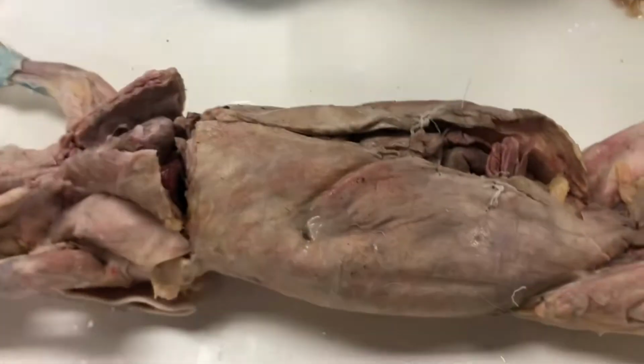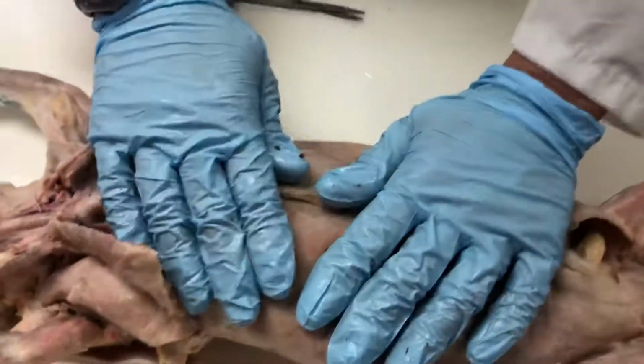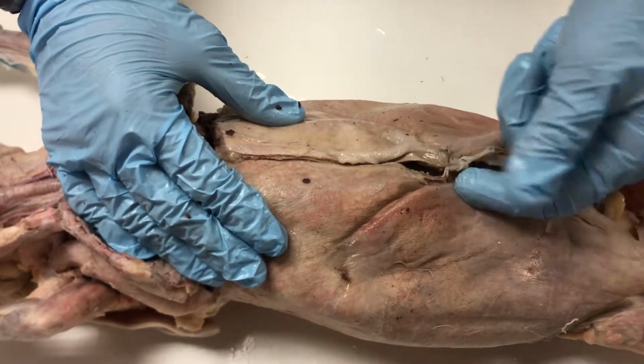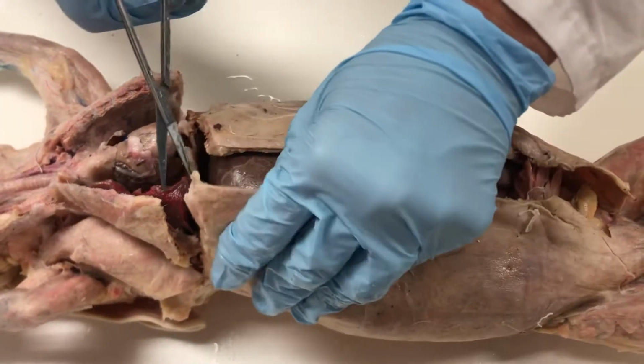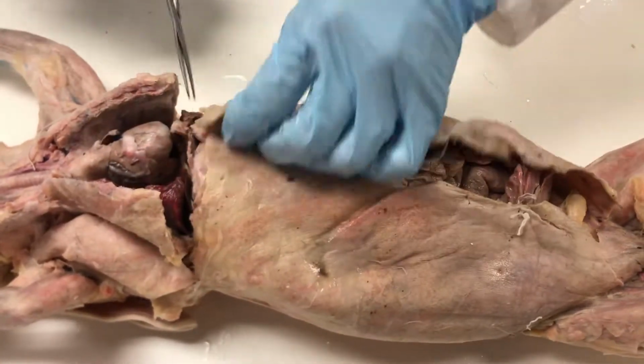All right, so today we're going to be getting into the abdominal cavity of the rabbit in order to see the digestive system organs. This is actually really easy to get into. The rabbit's abdominal muscles have already been cut here, and you just need to clip through the sutures if you haven't already. And then you're just going to make some lateral cuts up at the superior side, up along where the diaphragm connects. So one lateral cut here, one lateral cut here.